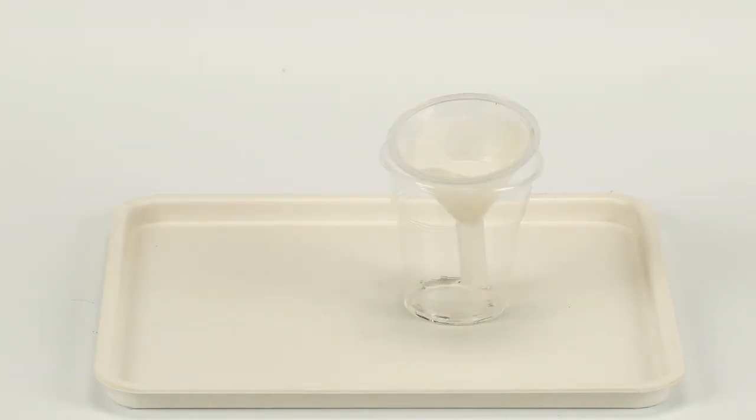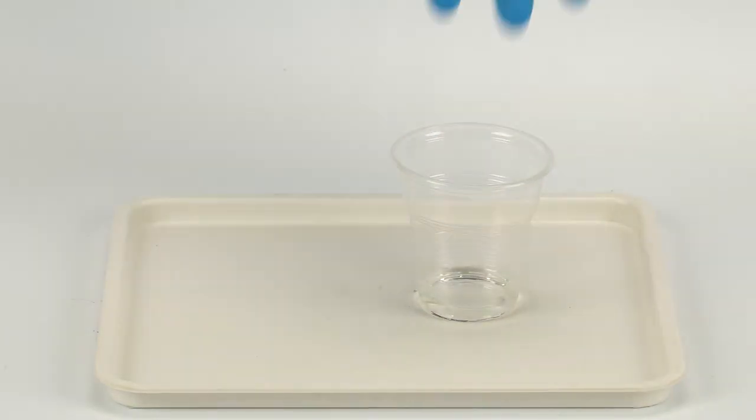Filter the solution in small doses. This will take some time. Prepare the setup for water electrolysis.